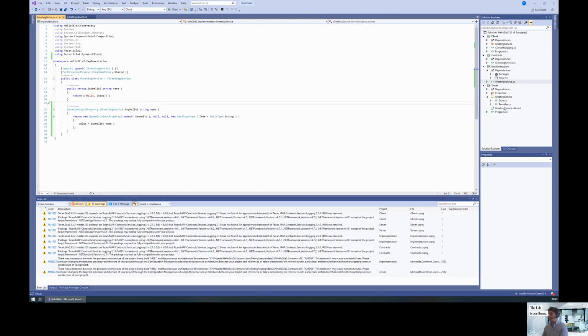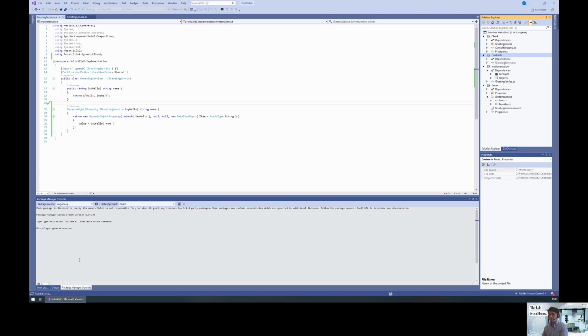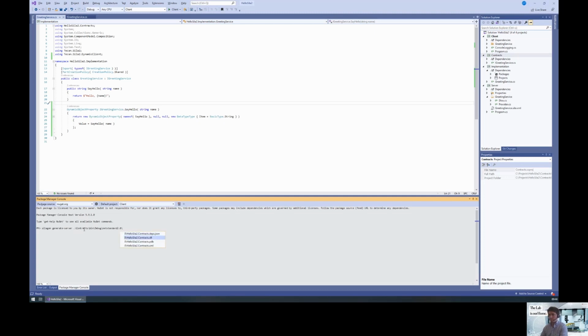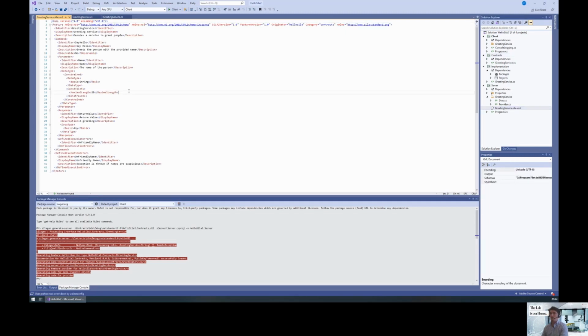Next thing is, of course, we need to update the generated code. So I'm going into the package manager console again. SiLA generate server. First we need to build the contracts, of course. Then the path to the contracts DLL, then the second one was the server project, and then the namespace, which was HelloSiLA2.Server. Okay, and here we are.